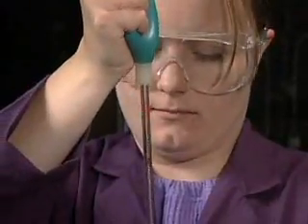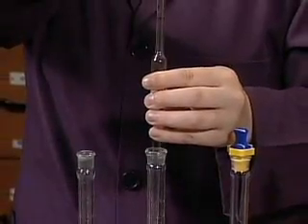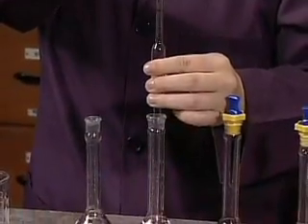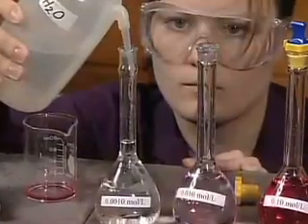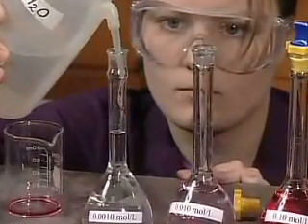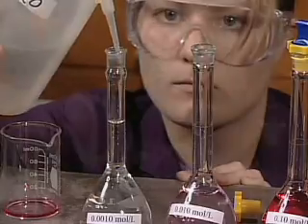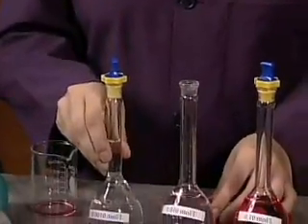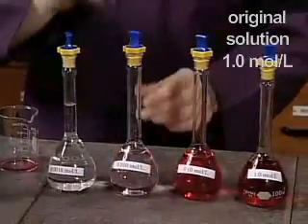A third dilution produces a solution with one-one-thousandth the concentration of the original solution. The intensity of the color of the solution decreases with each tenfold dilution.